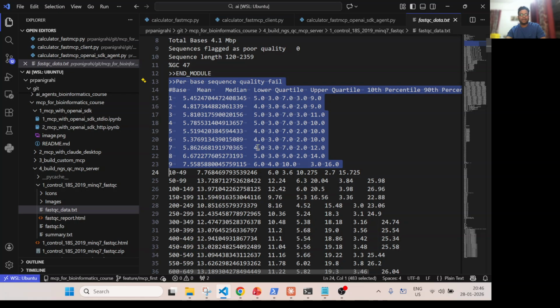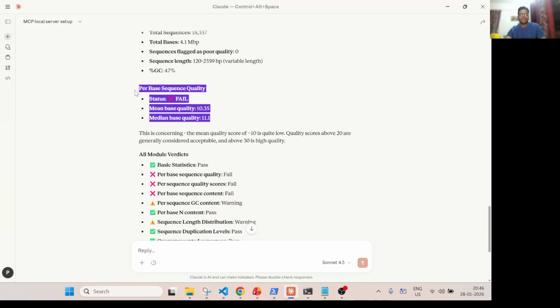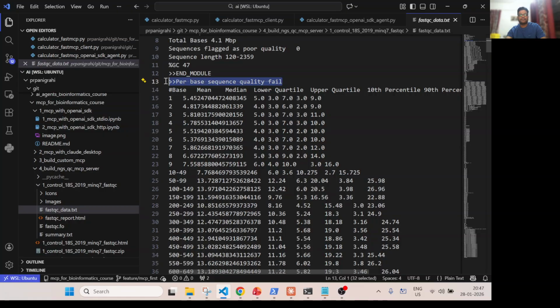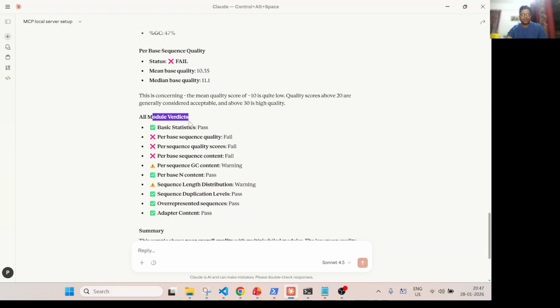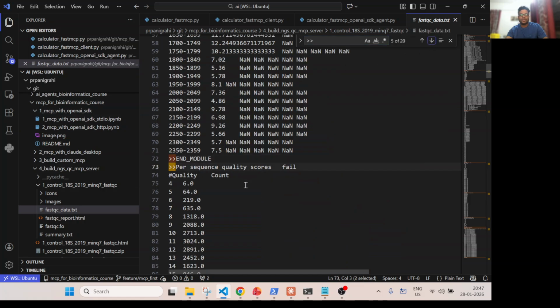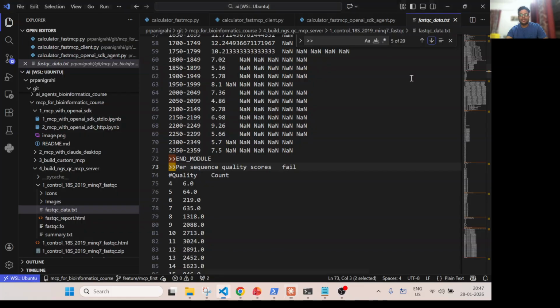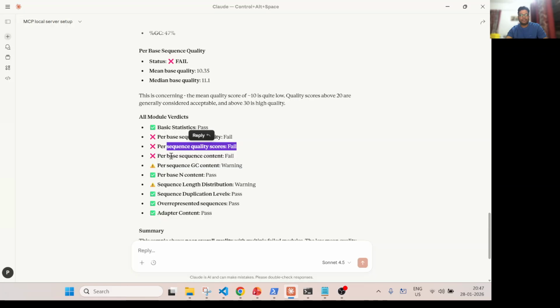Basically, I took this mean and median and took the mean of mean, mean of median, like that. So that's what the second one gave: the overall status was fail, because you see here it says that this block is fail. So that's what you see, that overall quality status is fail, and mean base quality is this one, and median is this one. And all module verdict means what I did, I just did a grep here. So basically if I type this one is fail, now the next module was this per sequence quality scores fail, per sequence quality scores fail, right? So you can see that I just did a grep, per base sequence content fail, per base sequence content fail.